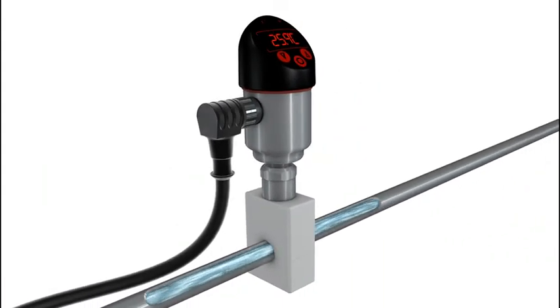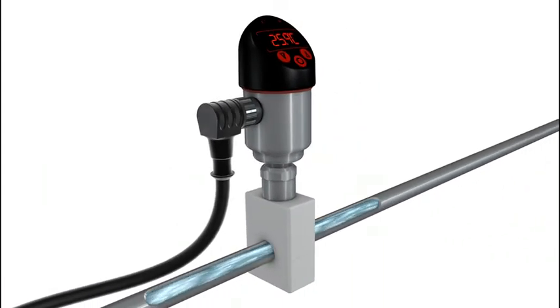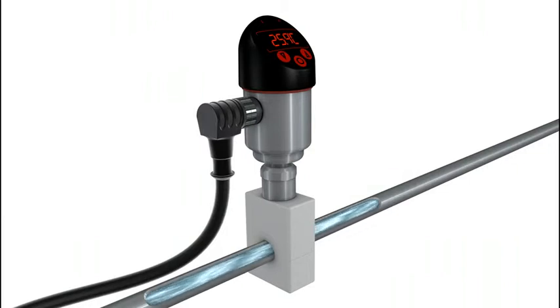Mounting the clamp-on device is a simple and straightforward operation. It is also very easily repositioned and disassembled.